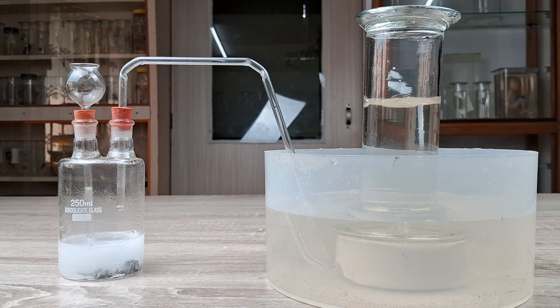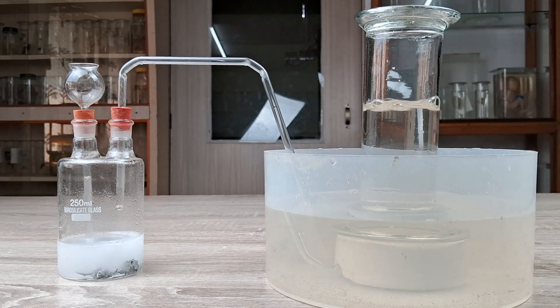So, this is how hydrogen gas is generally prepared in the lab for various purposes.